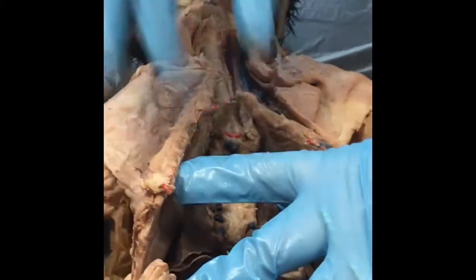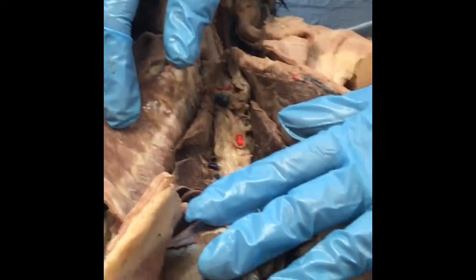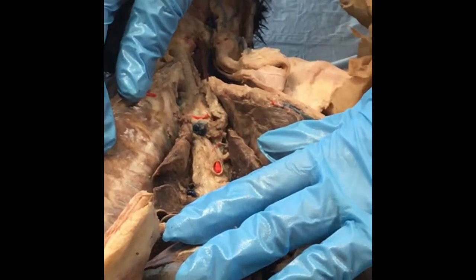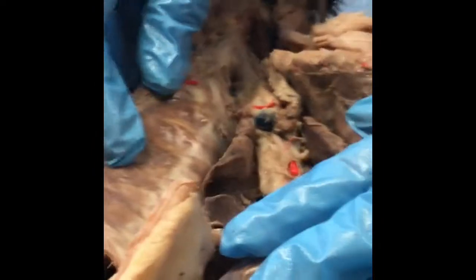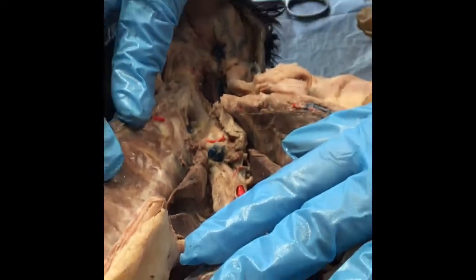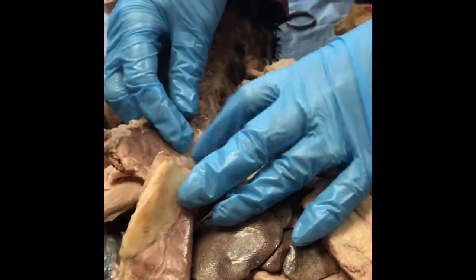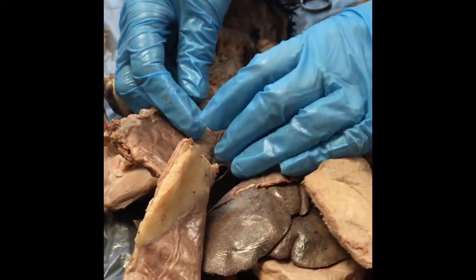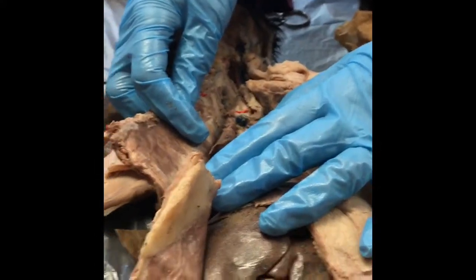Bronchioles, which are the actual smaller airway passages going down to the smallest cells of the lungs to exchange gases. Pulmonary arteries, which actually are blue. Why are they blue? Because they are carrying deoxygenated blood to the lungs to pick up oxygen. Pulmonary veins, which are the red, because they have the oxygen going back to the heart. So will I actually have a pin structure? We'll say, is this a pulmonary artery or vein? Nope, I will not. But those are the kind of questions that I will ask.